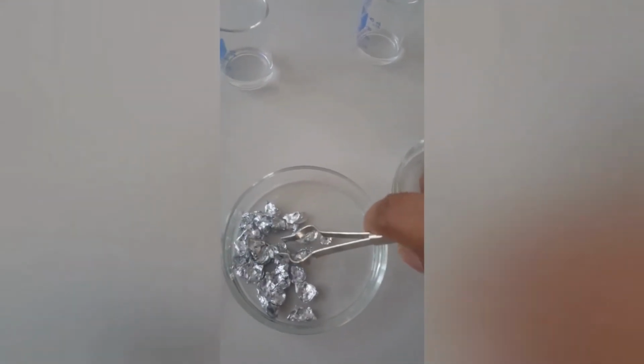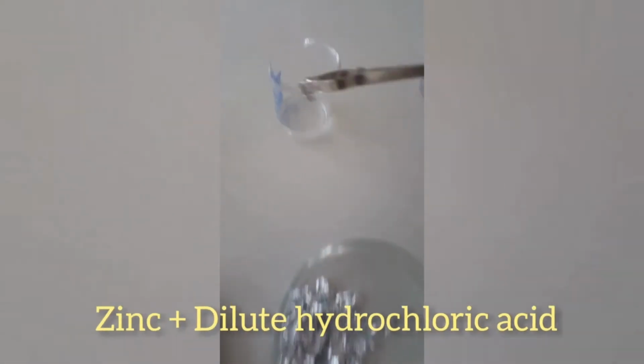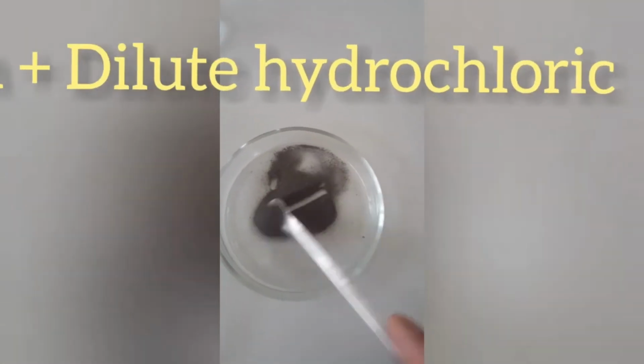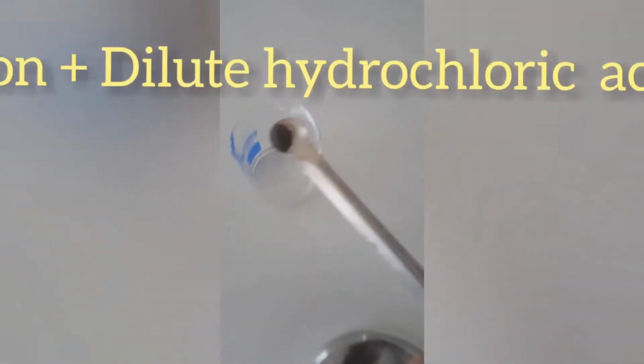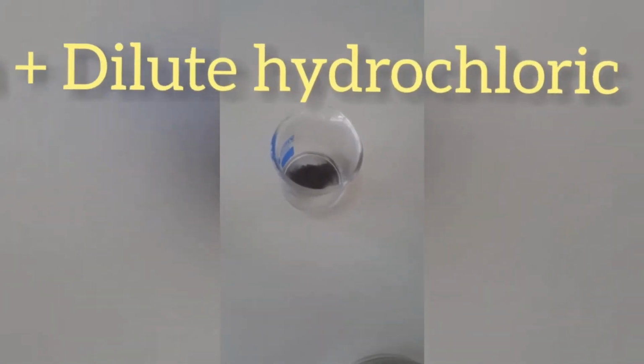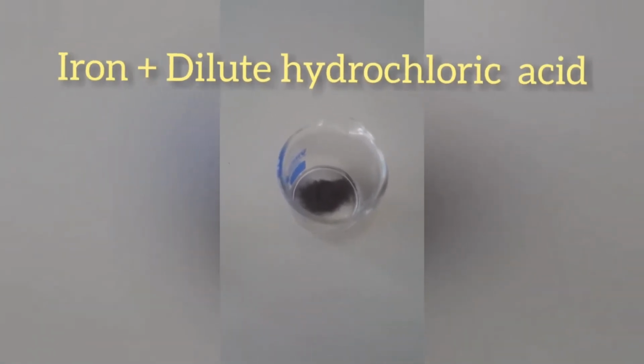Then add zinc granules to dilute hydrochloric acid. When you observe, the reaction is less vigorous than magnesium. And finally, we are going to add iron powder to hydrochloric acid. Now compare the reaction between these three metals.